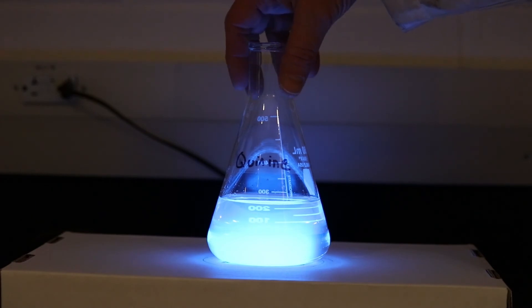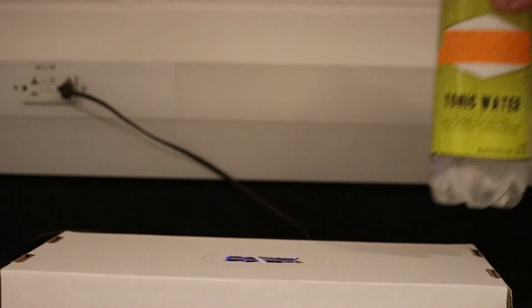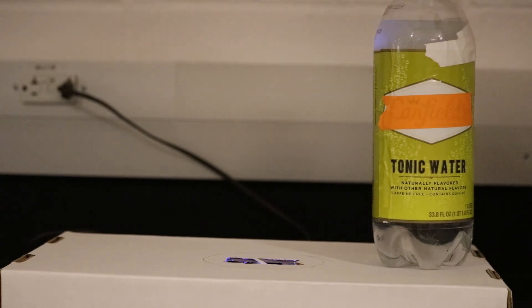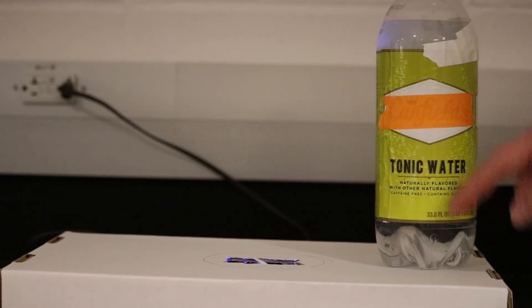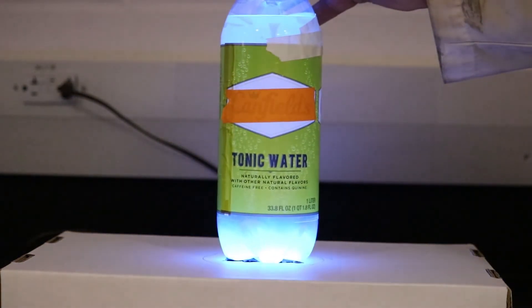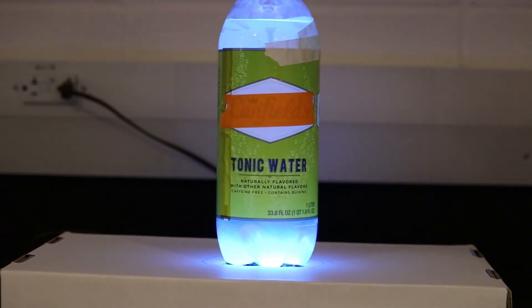Quinine is kind of interesting because we can find quinine in the grocery store because it is one of the ingredients in tonic water. Tonic water contains a significant amount of quinine. I've got some tonic water here. You can see that water is clear and colorless as well, but when I expose it to my ultraviolet light you can see how brightly blue that glows.